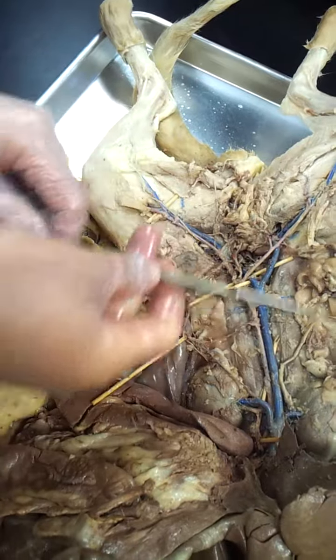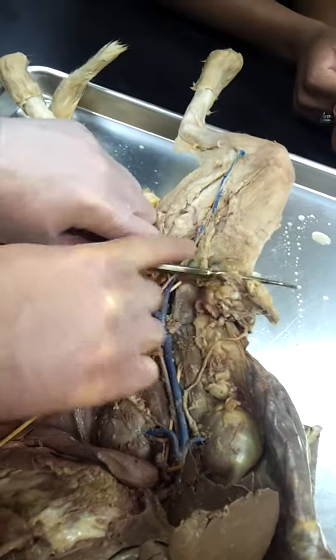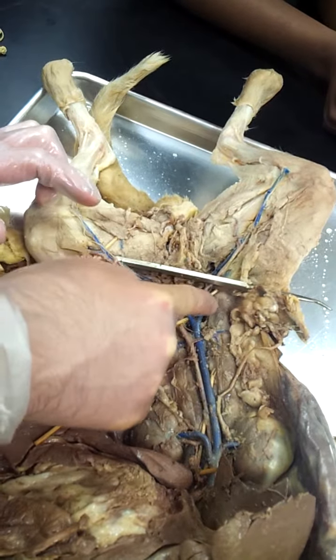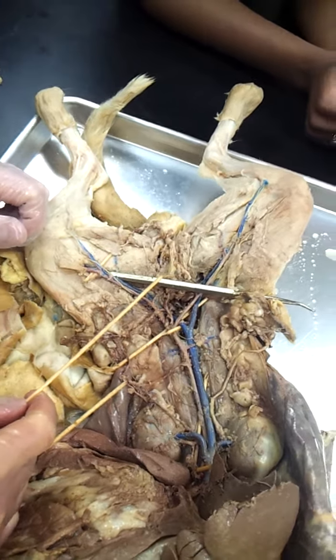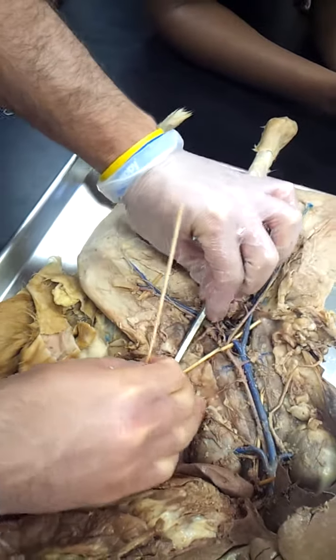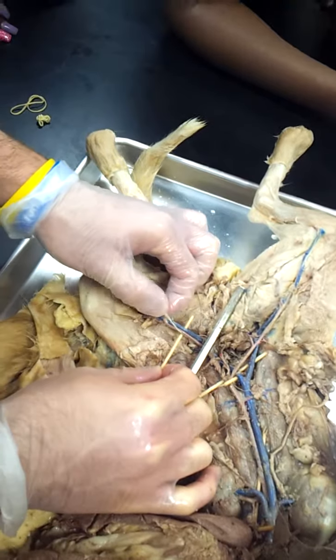So once we get outside to the pelvis, our pelvis would end right about here. And then we'll actually enter the leg. Once we enter that leg, that external iliac vein becomes what? Great saphenous vein, isn't it? I put femoral. So you can see here on this side how it becomes the femoral vein and artery. And there's also a nerve that runs right along with it.